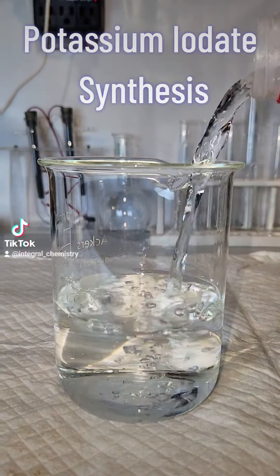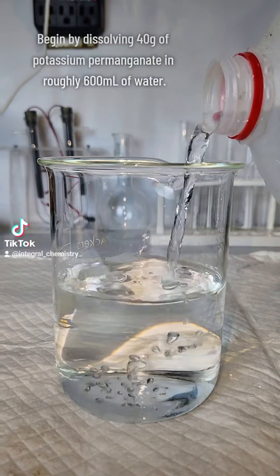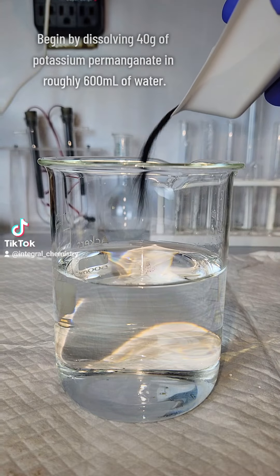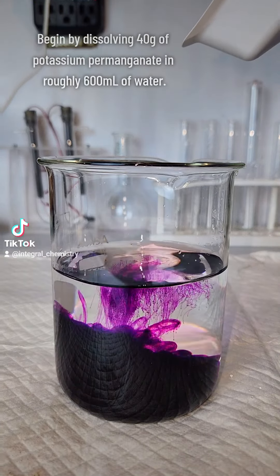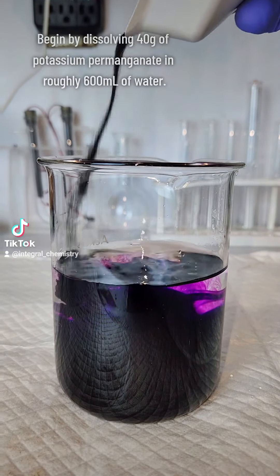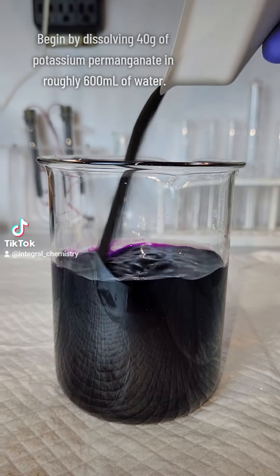I told someone in my comments that I synthesized the potassium iodate that I used for my Briggs-Rauscher demonstration myself, and I got a lot of people asking how I did it, so here it is.